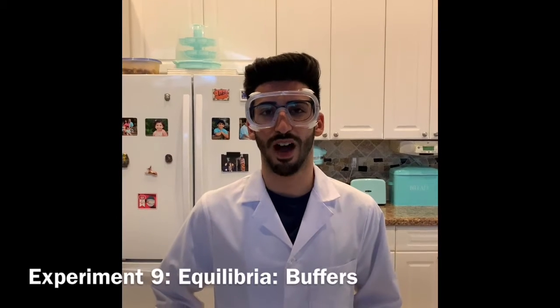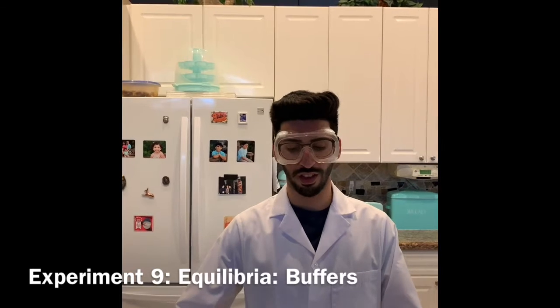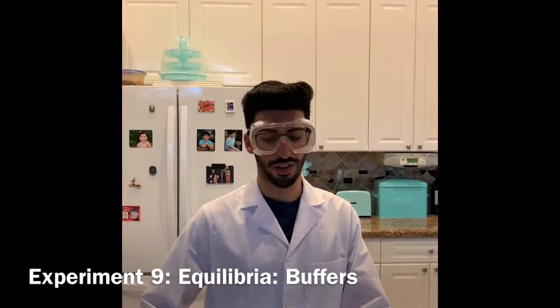Hi, my name is Joseph Muhammad Ali, and today we'll be doing experiment number 9, which is Equilibria of buffers. The objective of this experiment was to prepare and understand characteristics of buffer solutions.